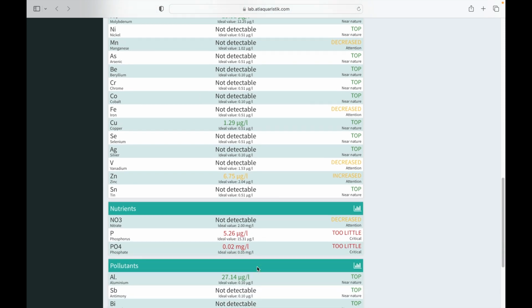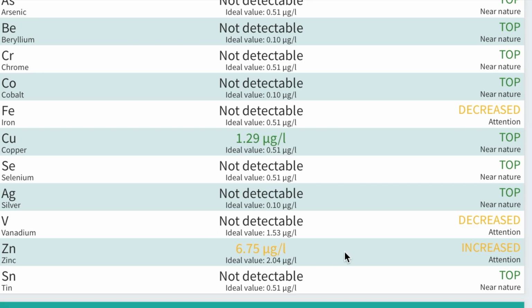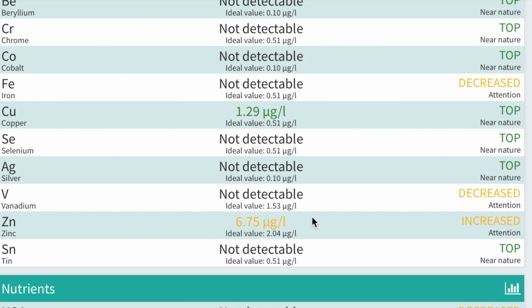Zinc. Okay, it's showing that the zinc is increased levels. It's a little bit high. It's actually showing it quite a bit high. It's not in red. So zinc. Aquaforest Lab tested this, said this was normal range. Their test showed the zinc as being in normal range, required nothing. So this says it's high. Aquaforest Lab says that it's normal, and ICP says that it's low, and I need to dose it.